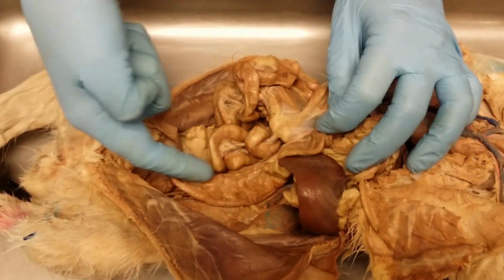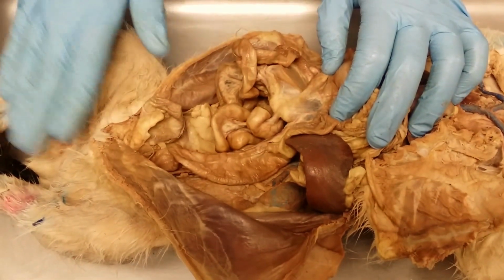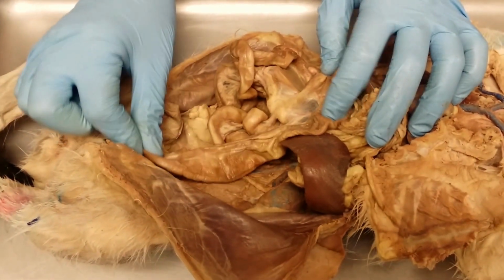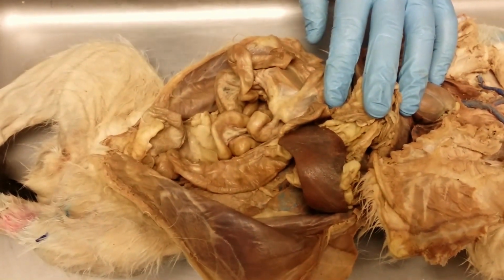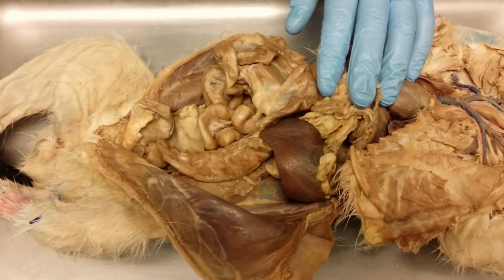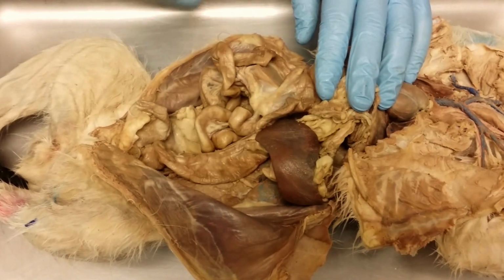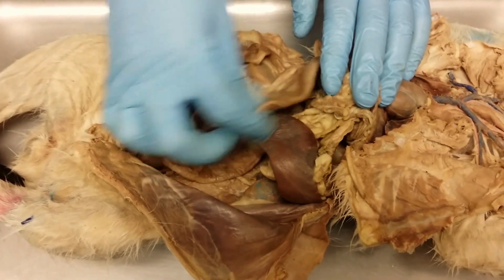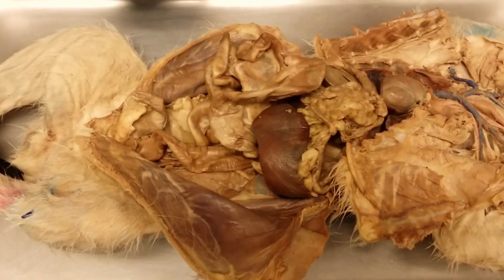You see it descending and it will eventually enter into the rectum and then the anal canal, which you don't have to identify on the cat. But in cats, there's not an ascending, transverse, and descending colon or large intestine like in humans. So on the models, the human models, I can ask ascending, transverse, descending, sigmoidal, rectum, anal canal. But on the cats, I can only ask large intestine, because they don't have those three parts.